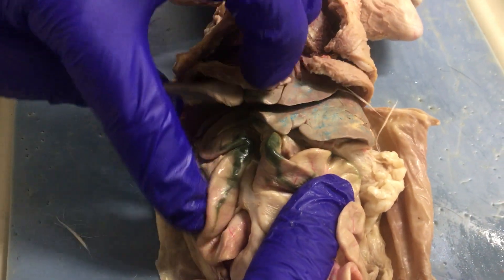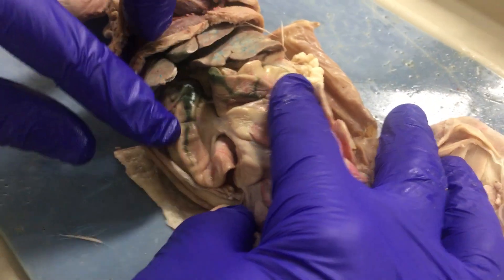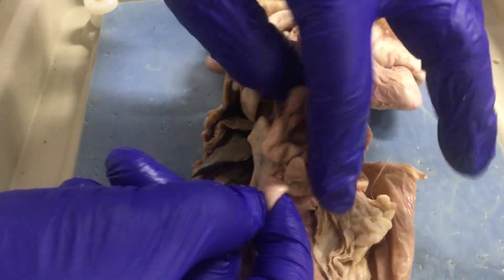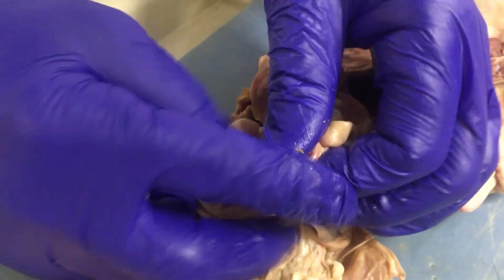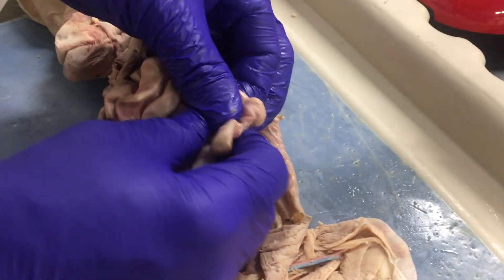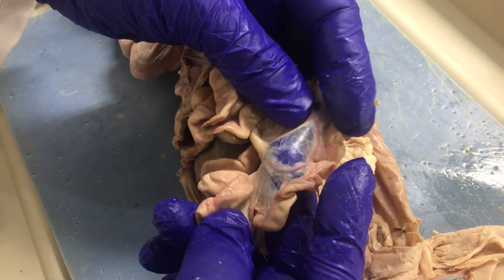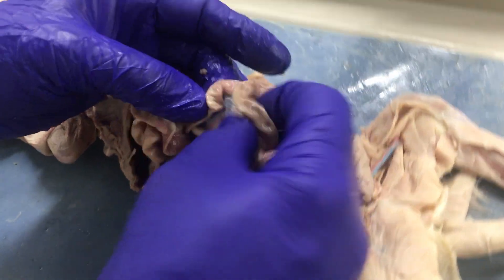The small intestine begins on the right side of the cat. Following it, this is the duodenum, and now we're in the jejunum, which makes up much of this structure. All of the small intestine is held by this transparent membrane called the mesentery.